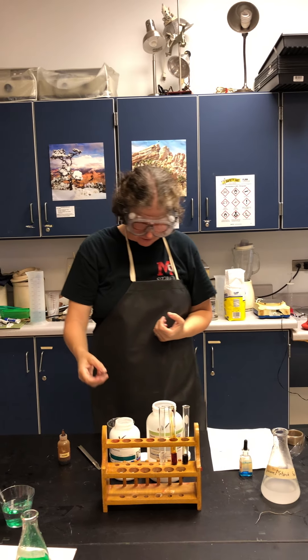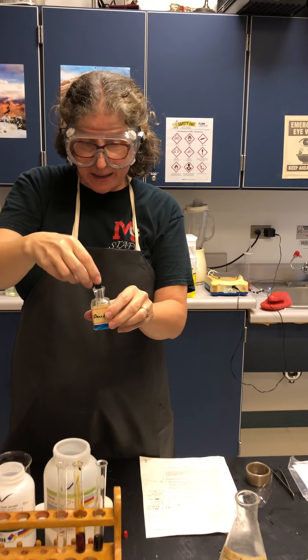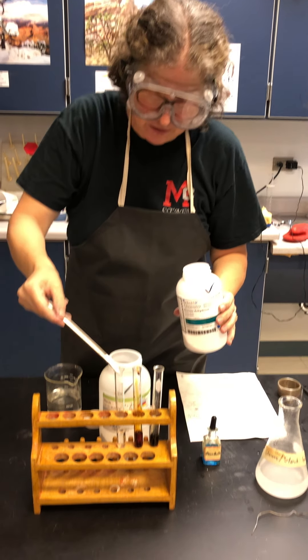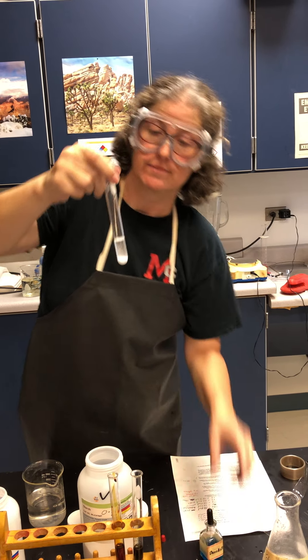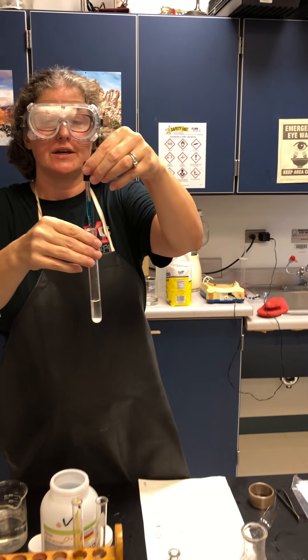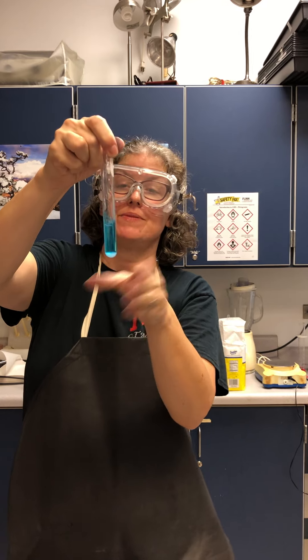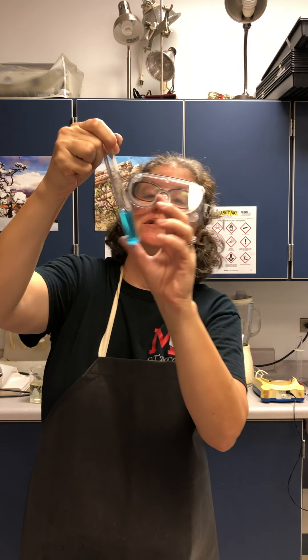Iodine does not test for glucose. There is a glucose test we have here called Benedict's Solution — notice the pretty blue color. Benedict's Solution will indicate if glucose is present. If I put some glucose into a test tube and add quite a bit of Benedict's, this is an indicator that does not work until you heat it — when heated, it will change color.